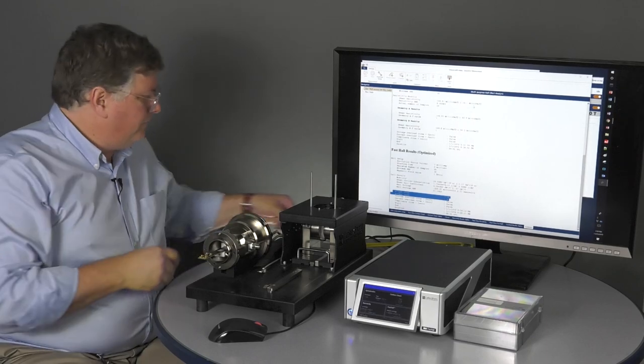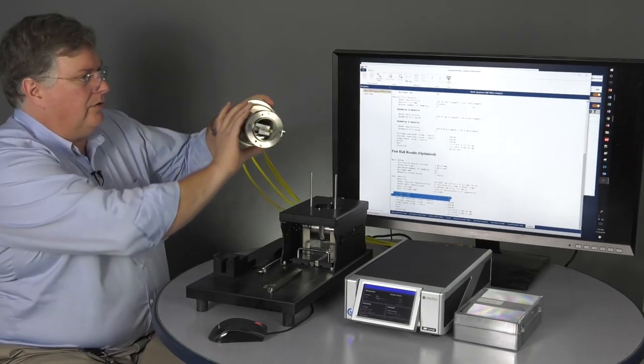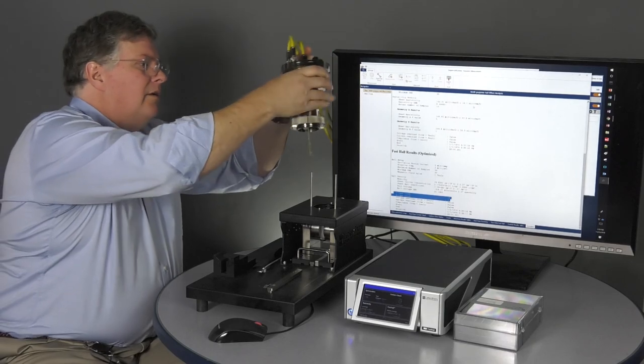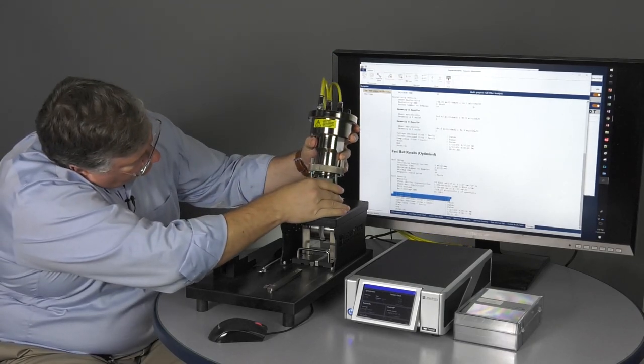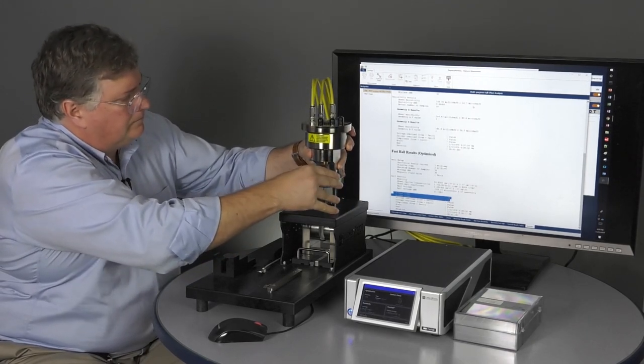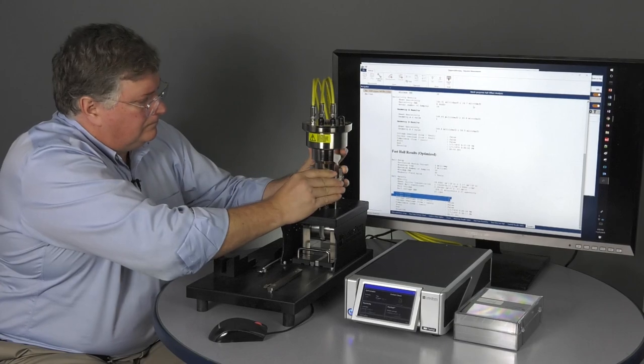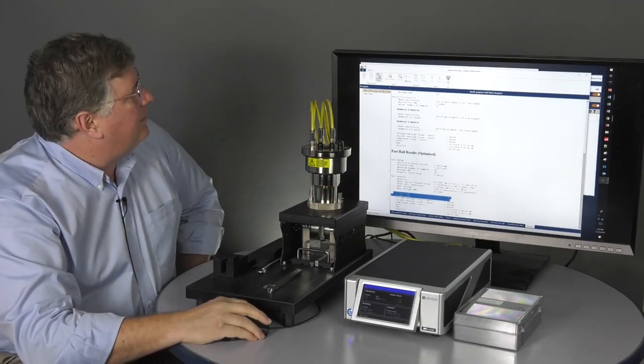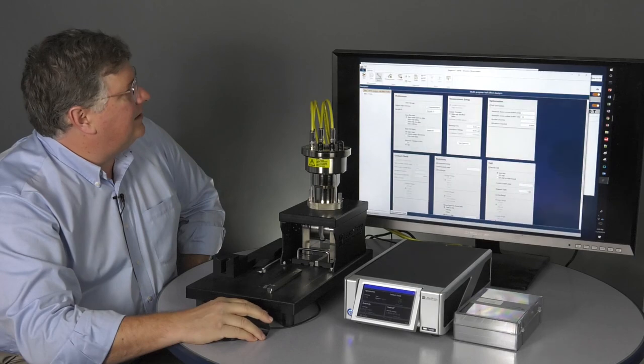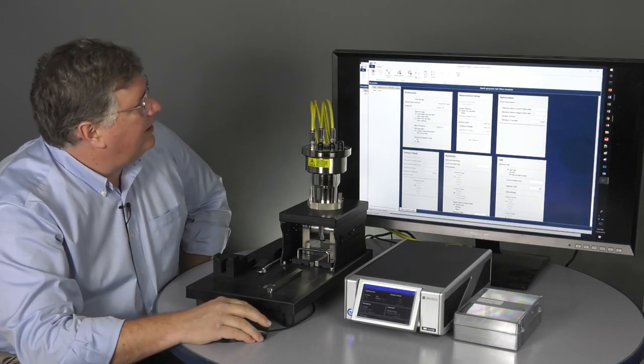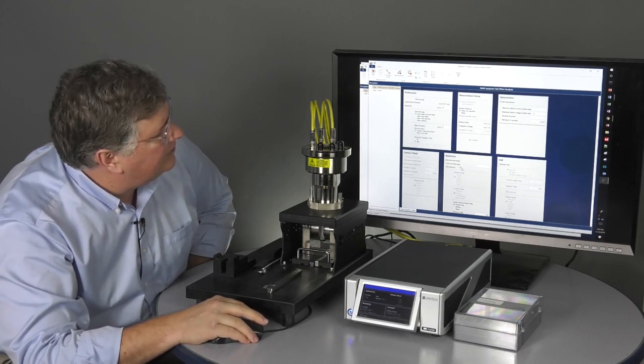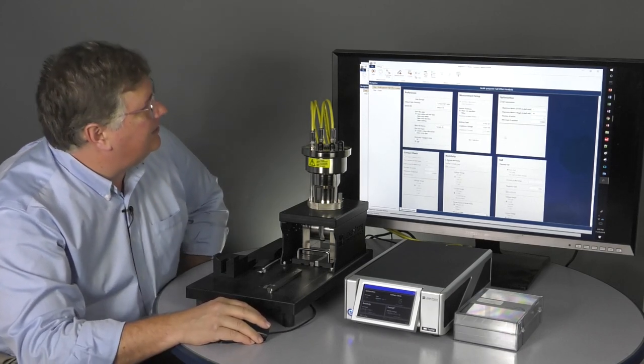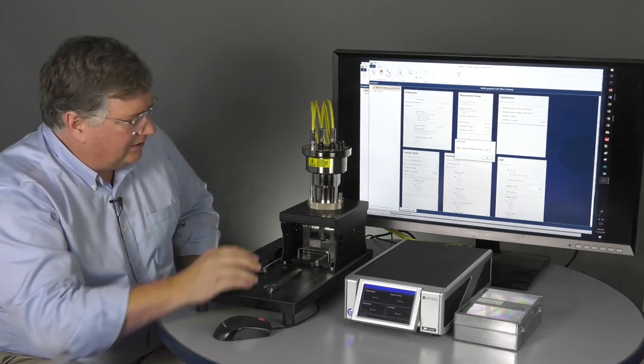Go ahead and land these contacts. I'll go ahead and reload that sample. I'm going to go ahead and just duplicate this setup so I'm really right back here ready to run again. And I think this time though, I'm just going to see if I've got my contacts landed well. I'm just going to go ahead and run just the contact check.